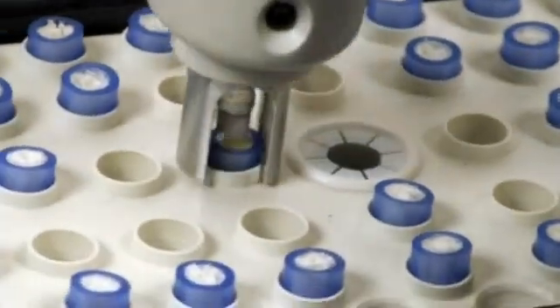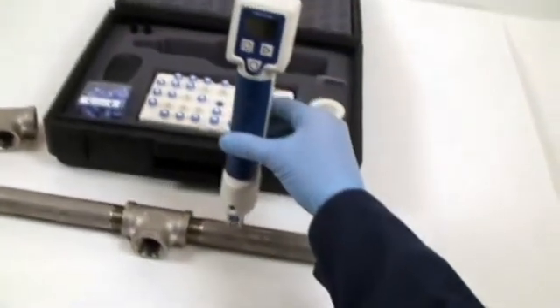Next, pick up the moistened nib with the probe. Then, test your metal.